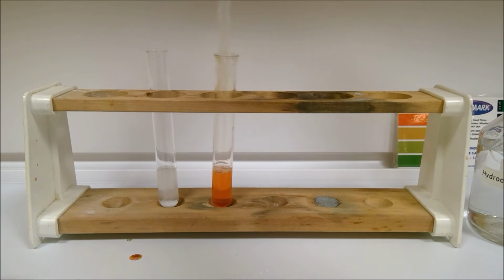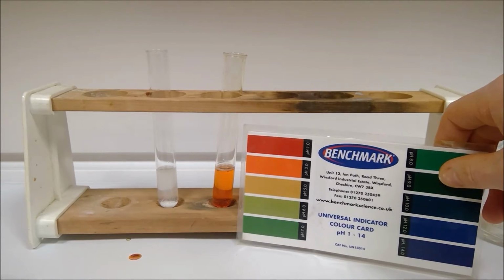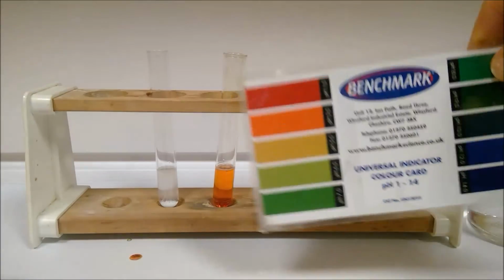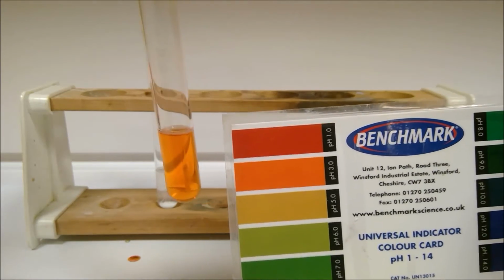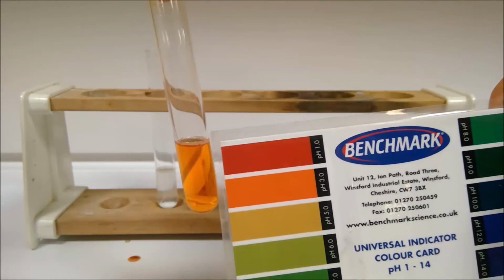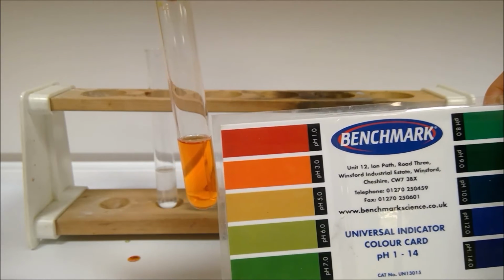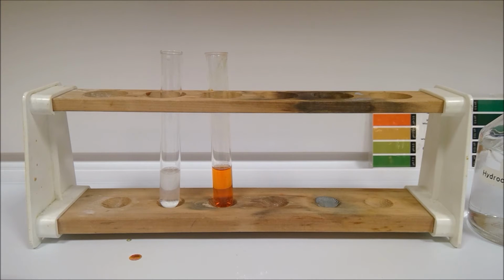So record the colour change, so what the universal indicator has changed to. And then here we go with the colour chart again, so you can record the pH that you think here. Let me just move that a bit further forward for you. Okay, so decide what pH we're going to record there. Remember that if you think it's kind of midway between like that red and that orange, you can record a pH 2. It doesn't have to be only 1 or 3. Okay, so you've got the whole scale to use. Then you can answer the question, is carbon dioxide an acid?